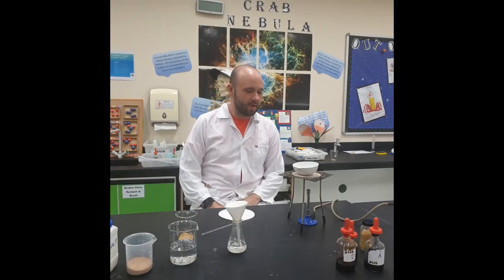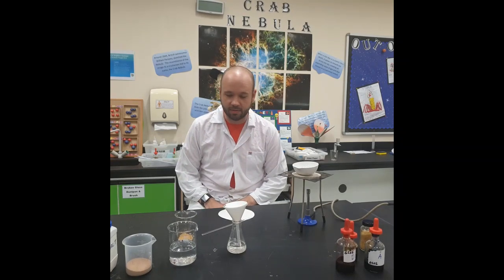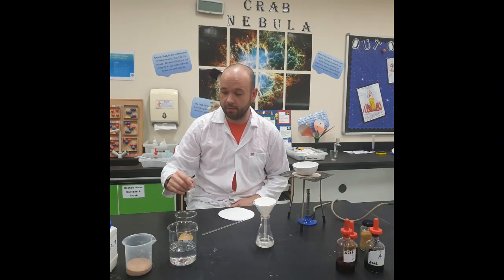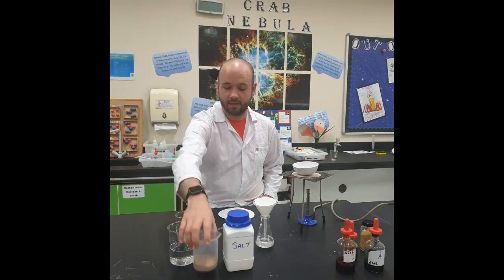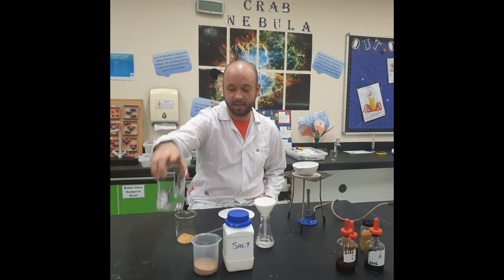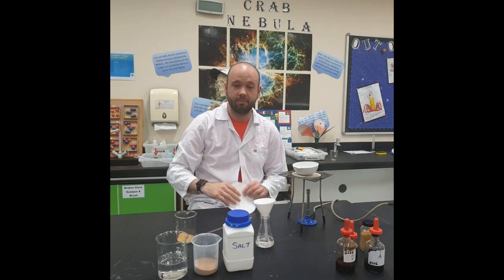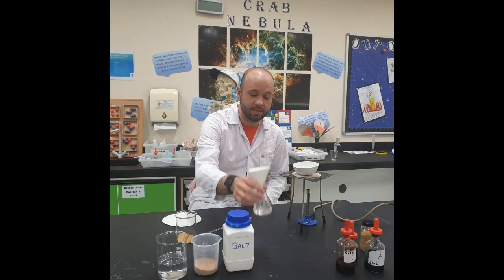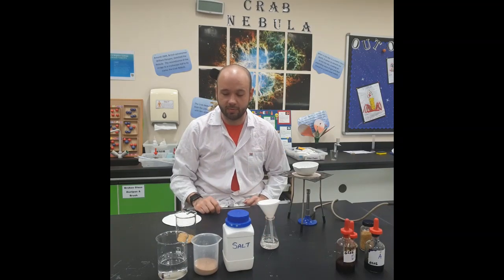Today we're going to look at filtration and evaporation. So what are we going to start with in terms of equipment? We need some salt, we need some sand, we need a solvent. In this case we're using some water. We've got a funnel, we've got some filter paper and a conical flask and a glass rod to stir with.